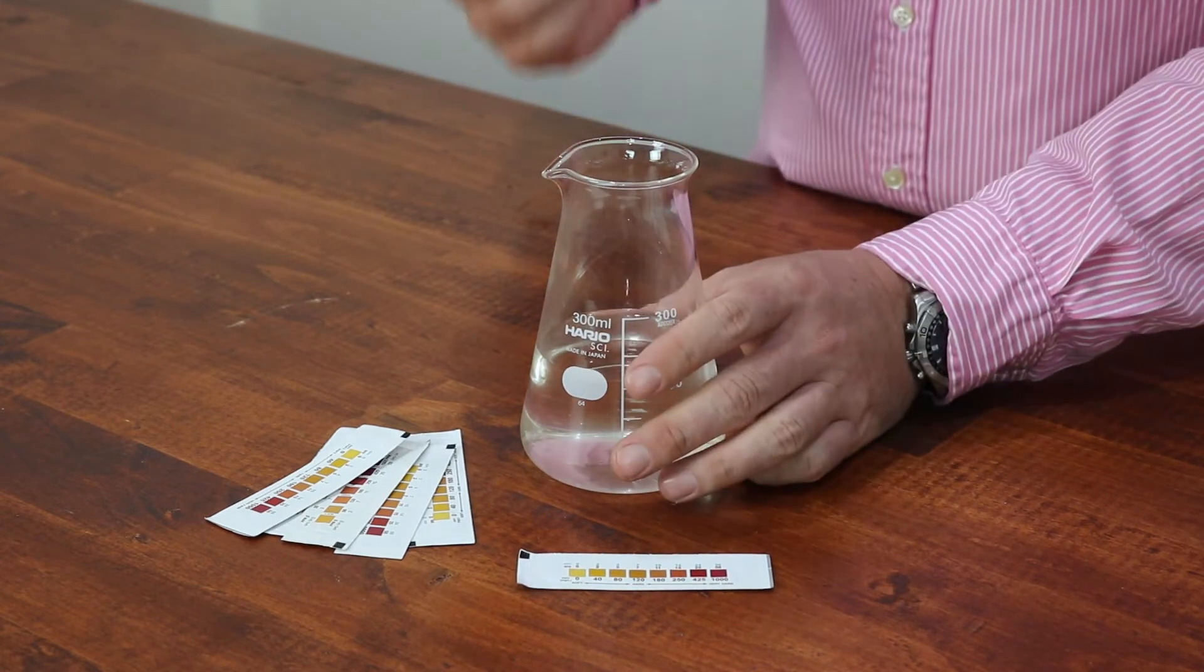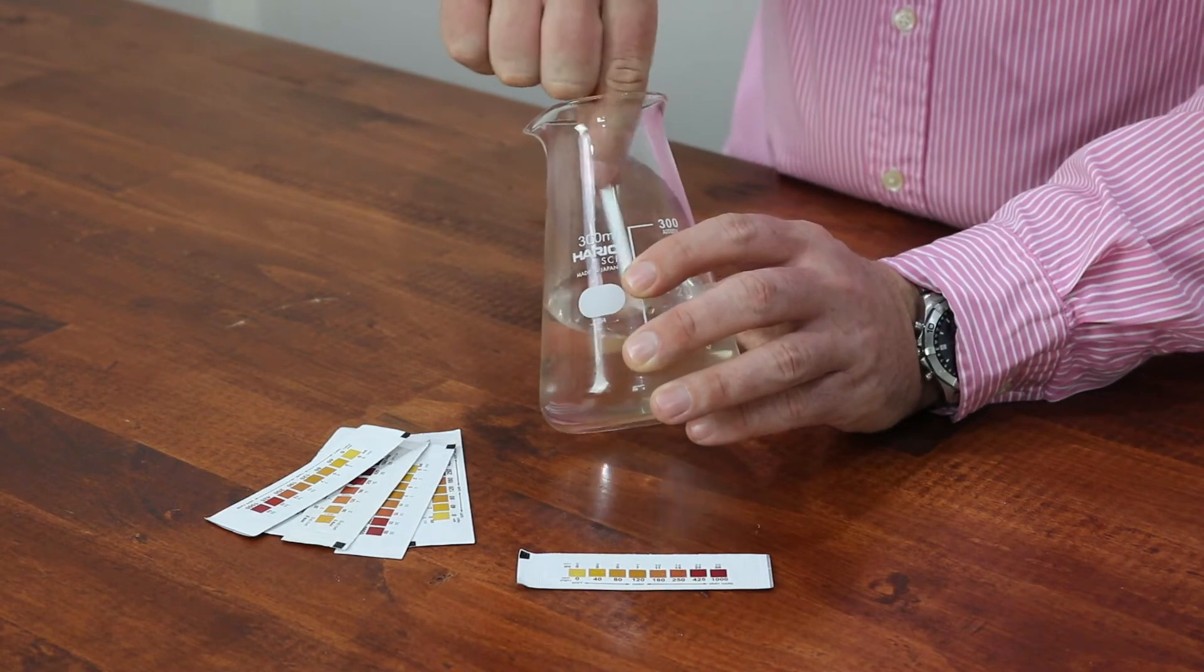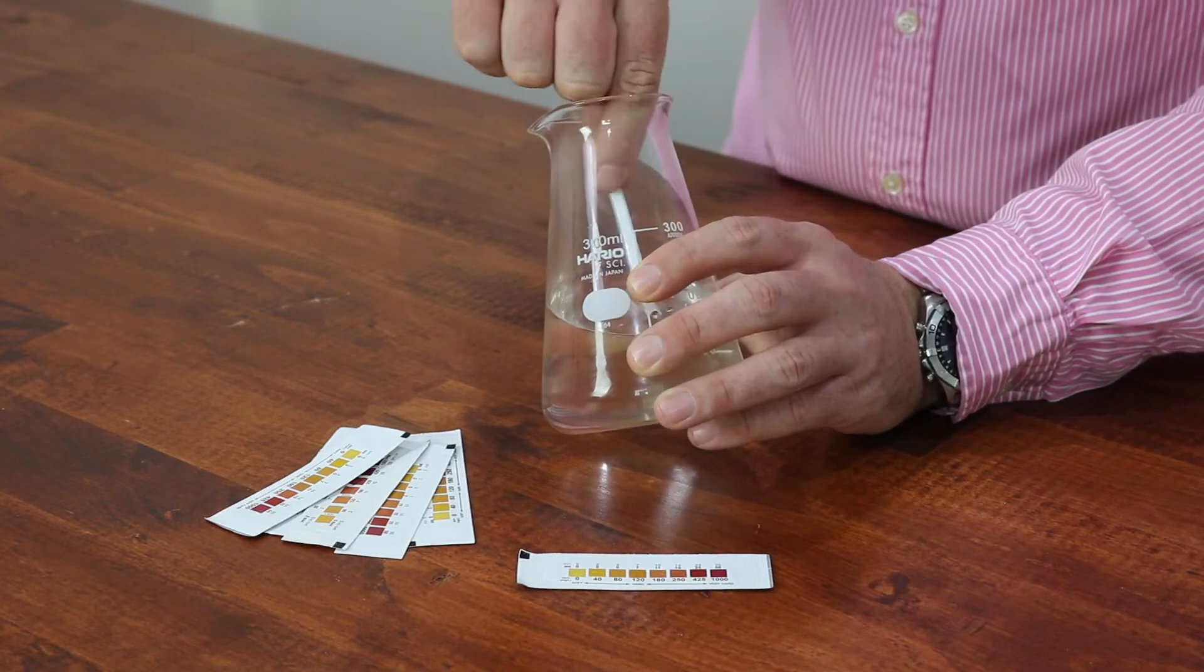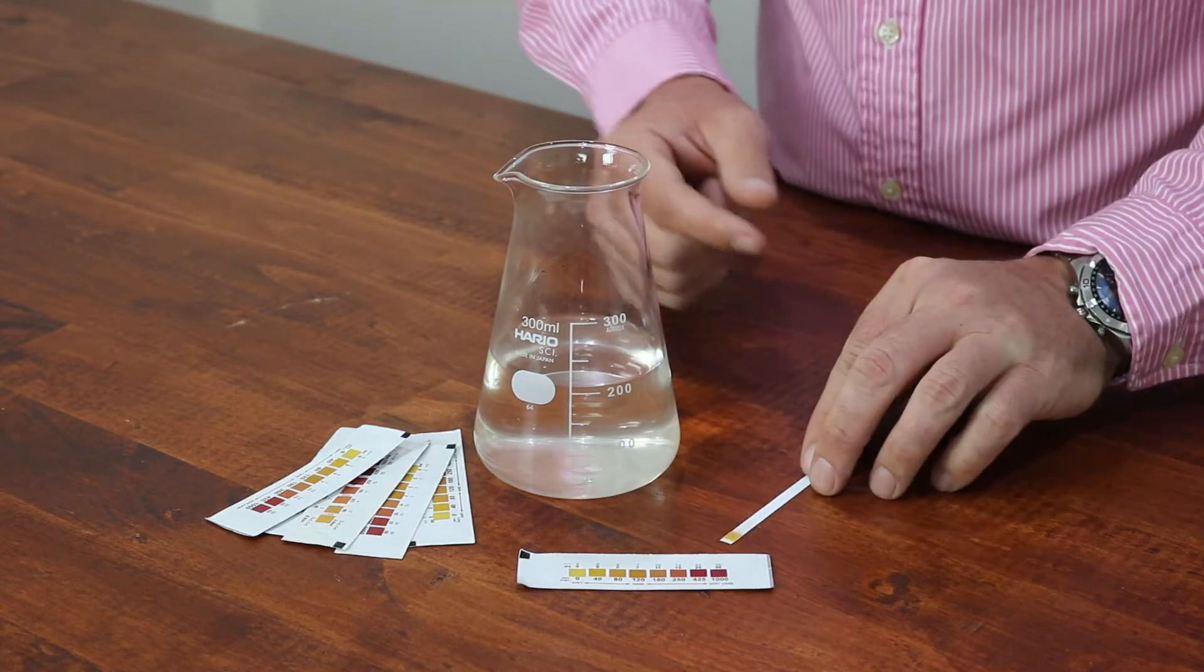Once that's been done, insert the strip that comes from the packaging into the water source. You want to hold that there for around three seconds and sit it to the side for approximately 20 seconds.